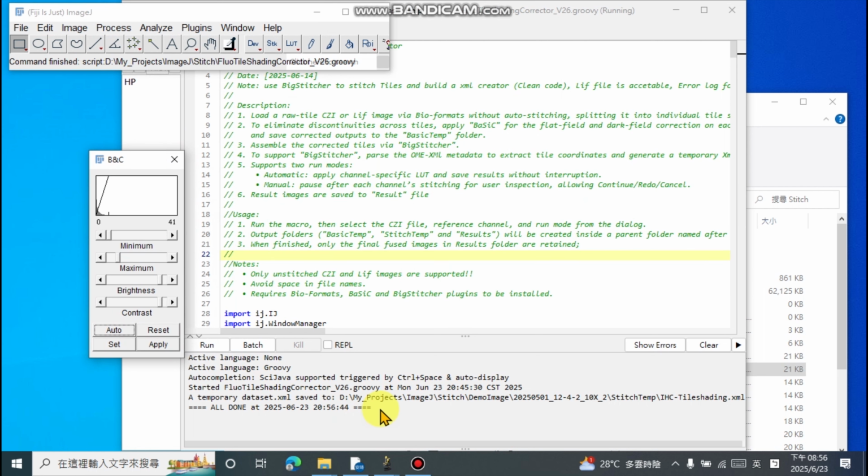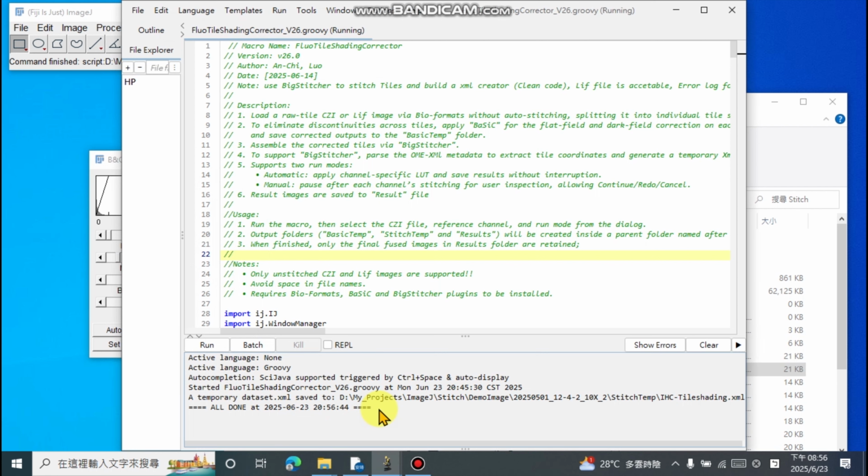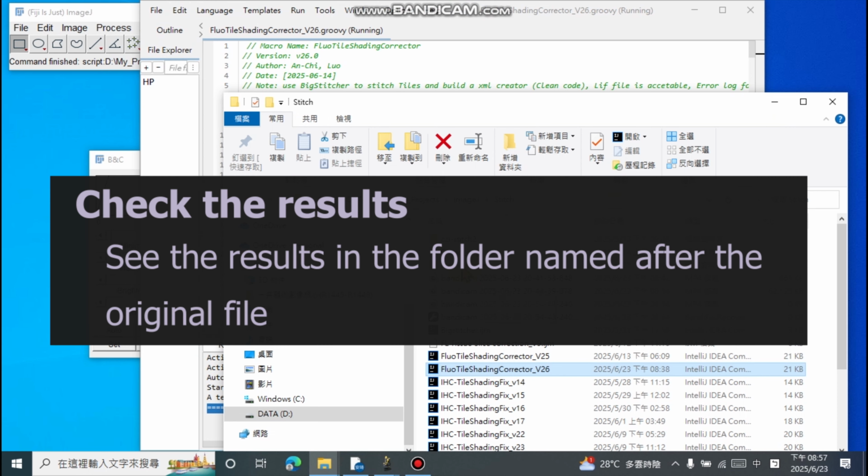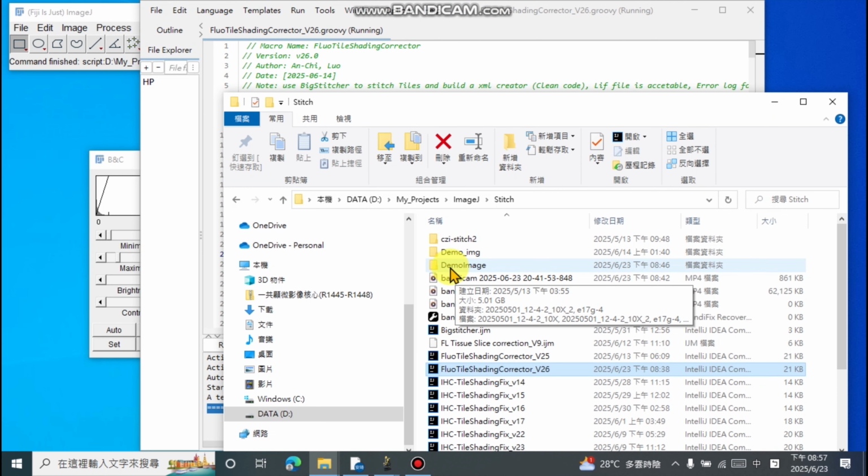All important information to note during the process will be displayed in ImageJ's console window. The processed image will appear in the original folder under the original data name.